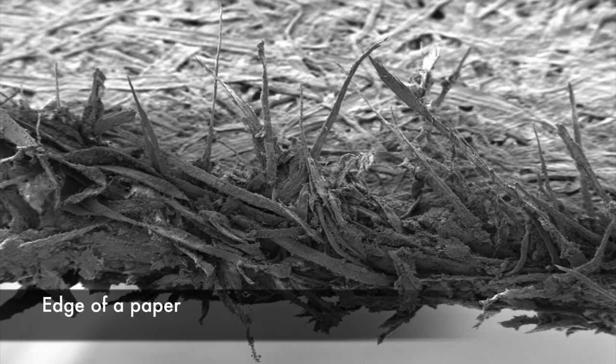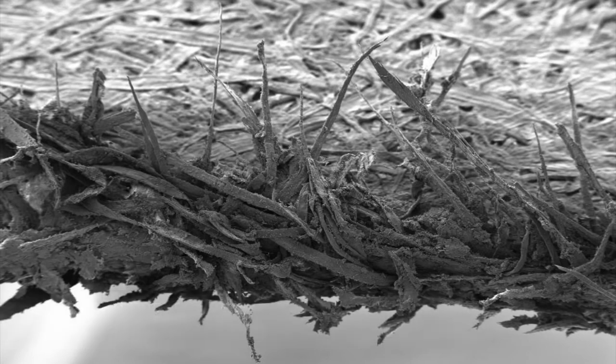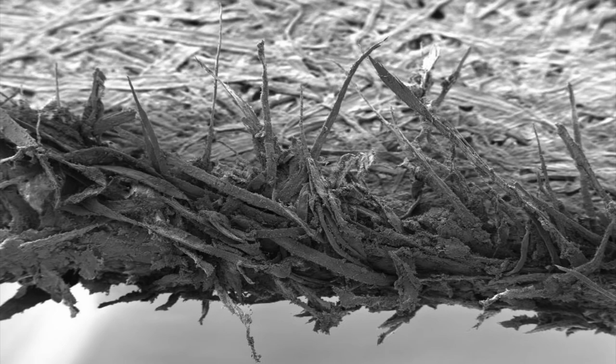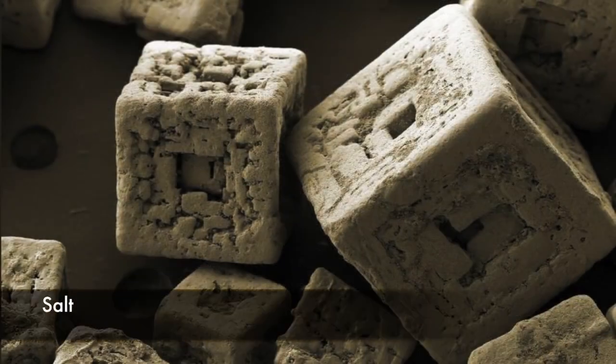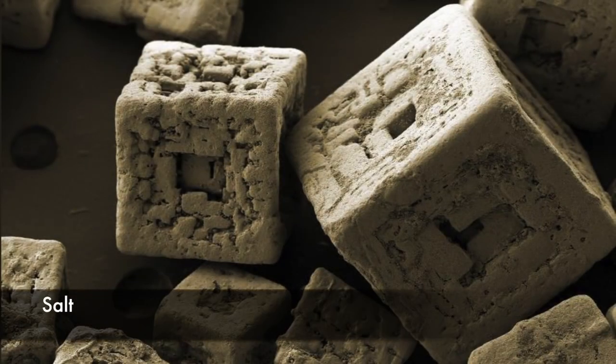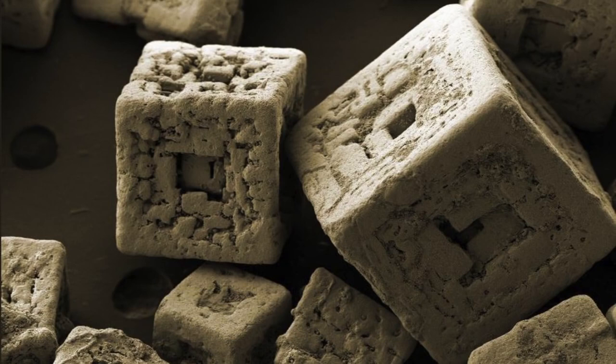The edge of a plain piece of paper. These are grains of salt, a mineral composed primarily of sodium chloride, essential for life in general as well as being one of the basic human tastes.